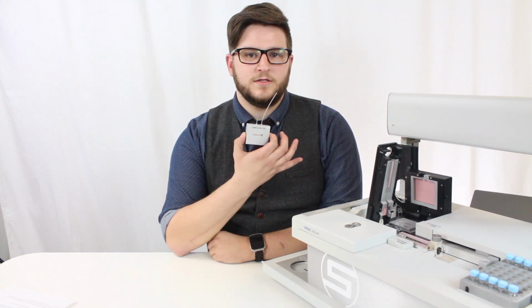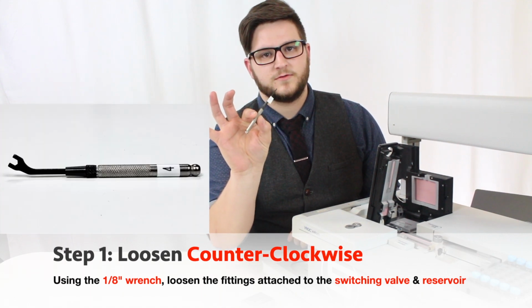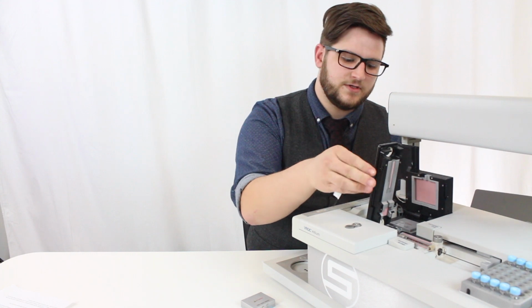And today I'm going to go over how to swap out the VROC sensor or chips on your Initium units. First thing you're going to need to do is take one of these 1/8 inch wrenches, and then you are going to undo 2 separate fittings.